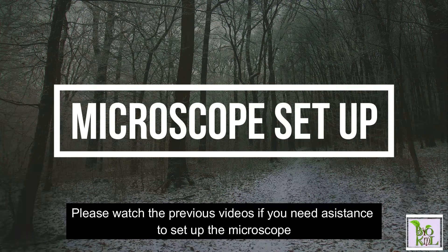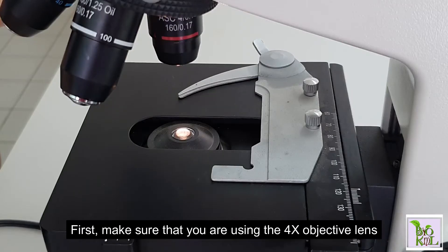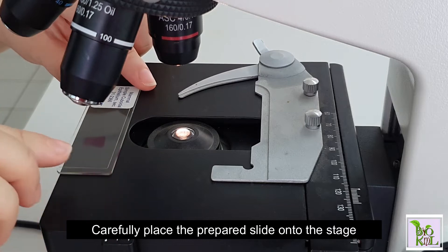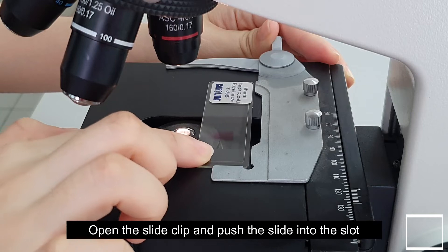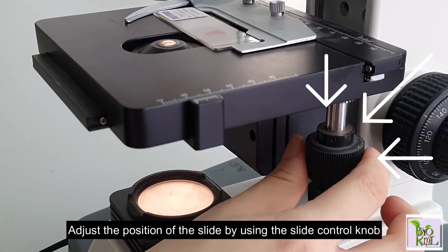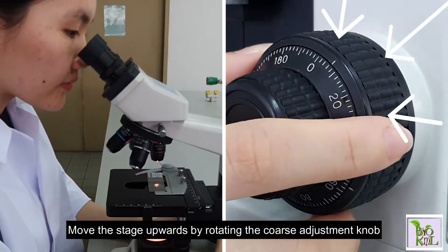Please watch the previous videos if you need assistance to set up the microscope. First, make sure that you are using the four times objective lens. Next, carefully place the prepared slide onto the stage, open the slide clip, and push the slide into the slot. Adjust the position of the slide using the slide control knob.